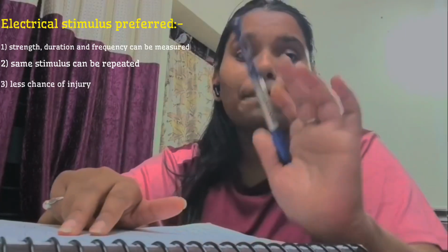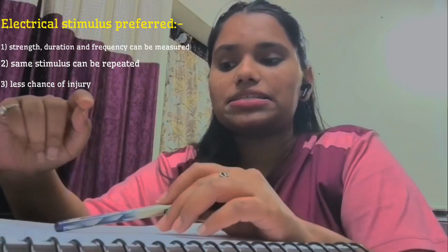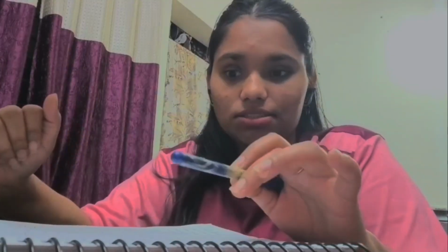Damage to the tissues is minimum with the electrical stimulus, whereas if we use chemical stimulus like acids or any other bases, the risk of injury to the tissues is high, which is very minimal in the case of the electrical stimulus. That is another reason.